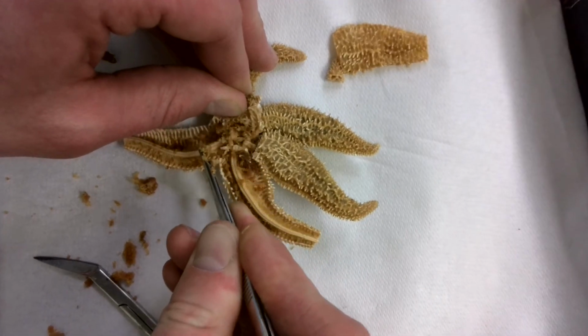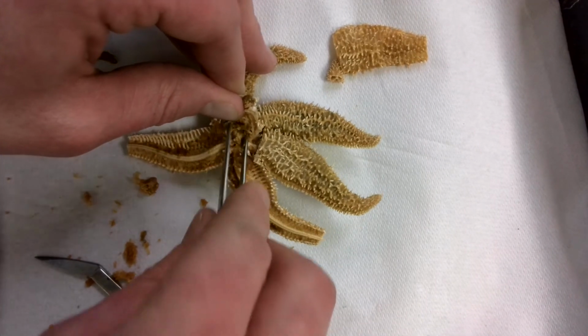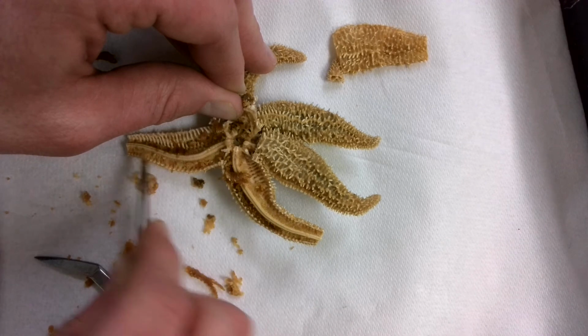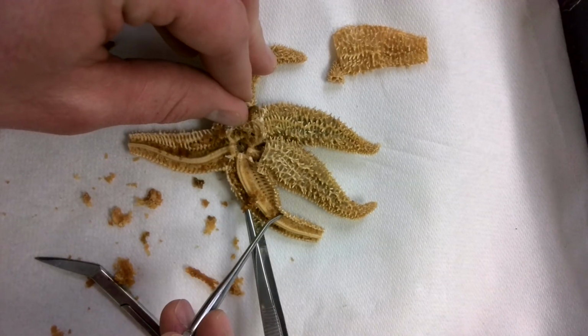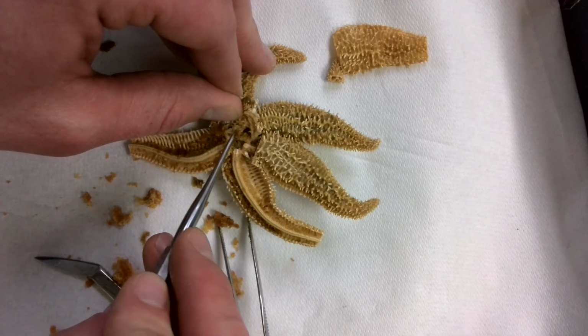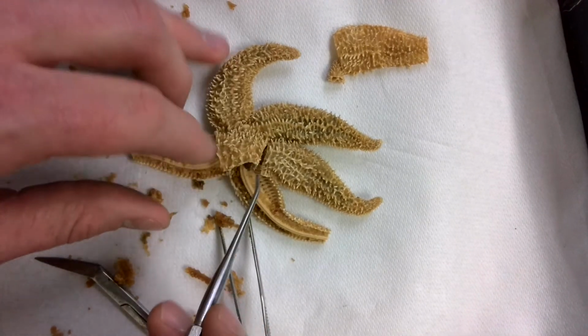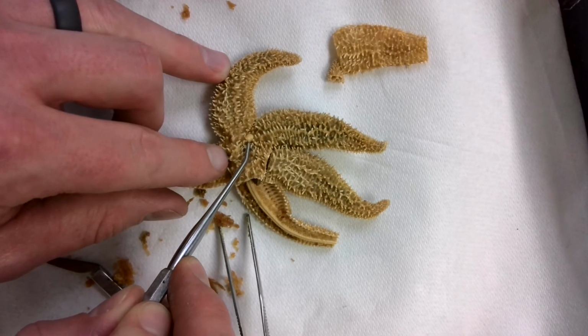That would be kind of like when you go down to lunch, if when you get your tray, you would just regurgitate your stomach out onto the tray. Then the digestive gland, which we already pulled out and which was found here, excretes a bunch of enzymes which allow the starfish to basically dissolve the clam, suck it back up into its stomach, then pull it into its mouth.